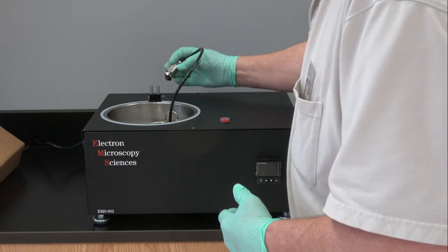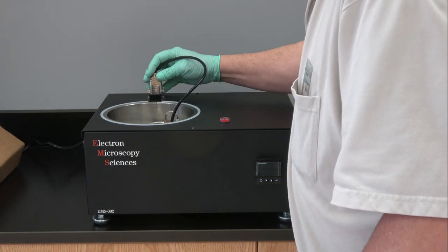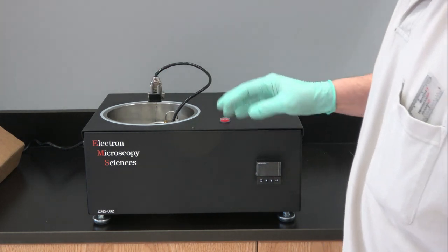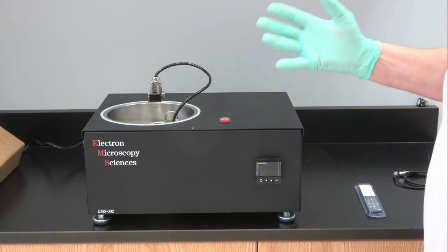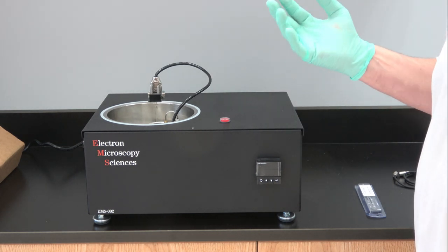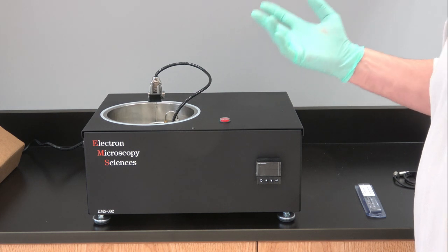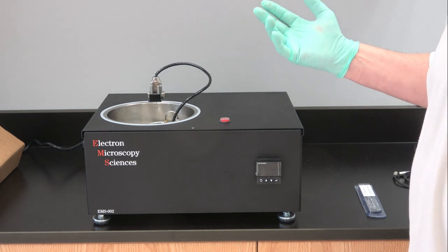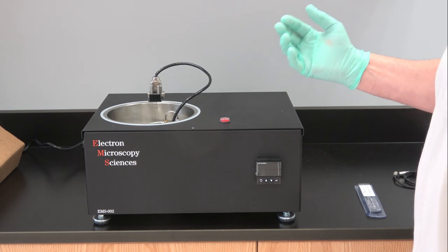This cable gets plugged in on top here. I've made all the different plugs and connections so they will only go in one place, so you can't really mess this up, or shall I say I made it difficult for you to mess up.